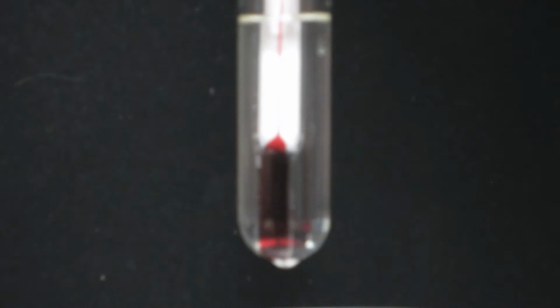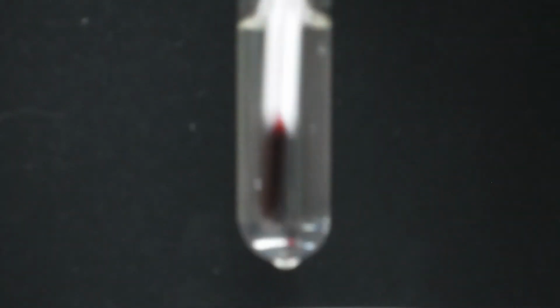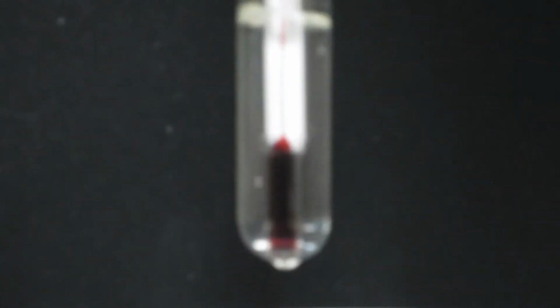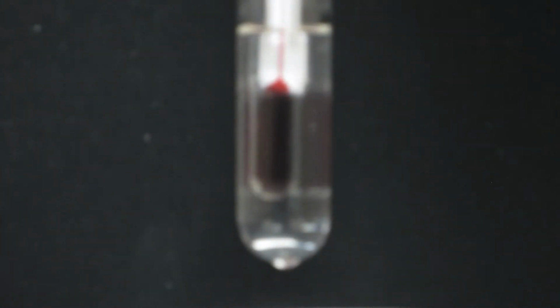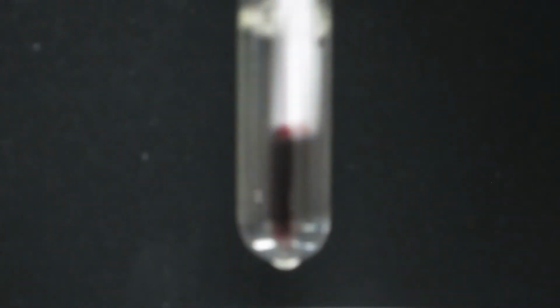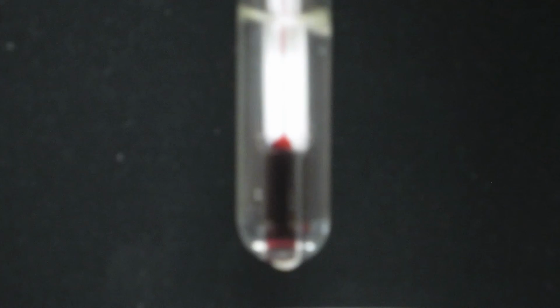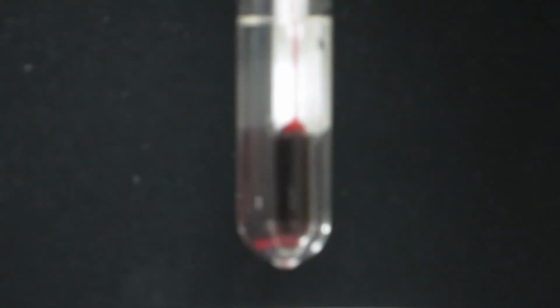And this may be impossible to see, but we're going to try. So we're going to watch the crystals form, all right? And then what I'll do is I'll record the temperature and let you know what it is. That way you can hopefully see what I mean by a very slight precipitate. And it happens very quickly. The temperature is just under 60, so it's dropping slowly, which is what we want.